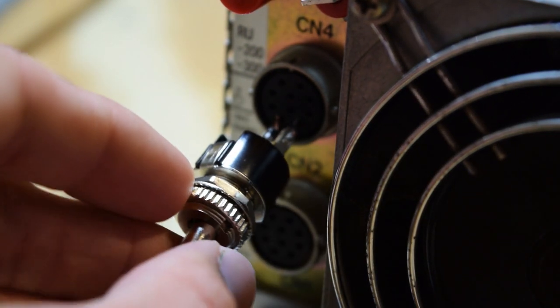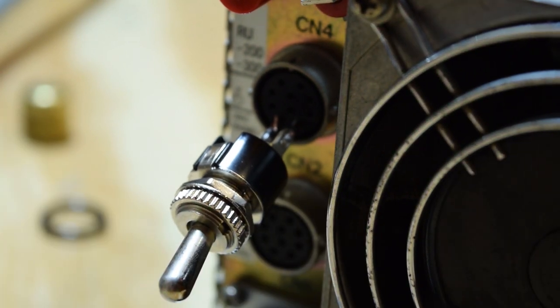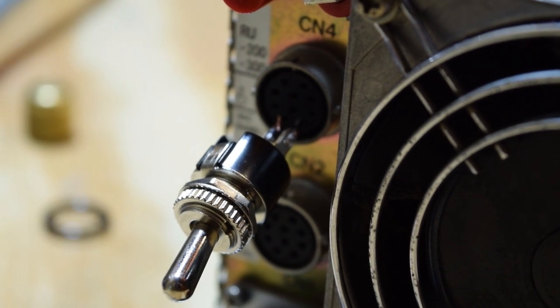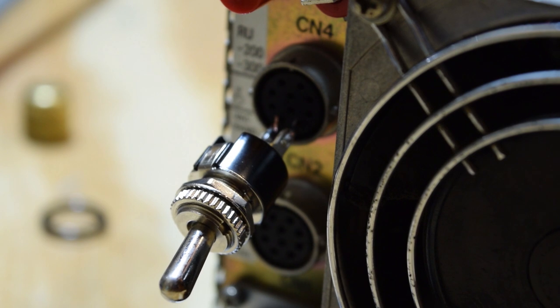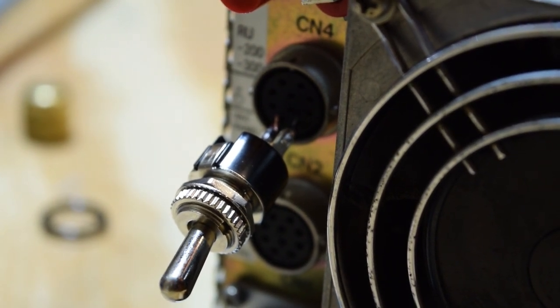This switch that I've installed over here on a couple of pinouts is used to start the turbo pump acceleration. This is the part that took me so long to figure out. I couldn't get the pump to start — I thought it would automatically switch on when the correct pressure was reached. It took me looking through some circuit diagrams of the controller to find out this was not the case, and I needed to install this switch myself.